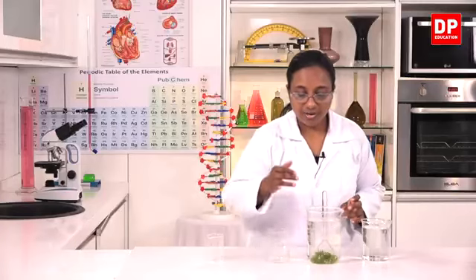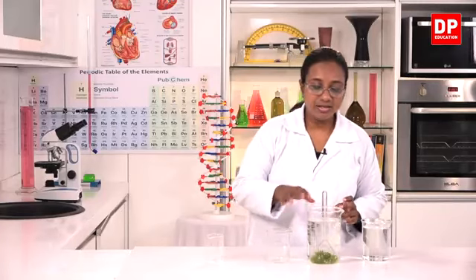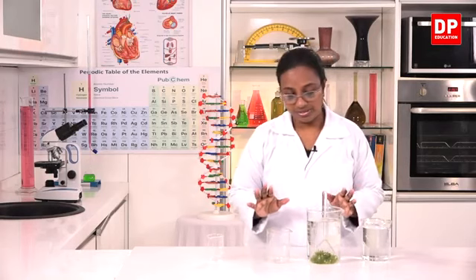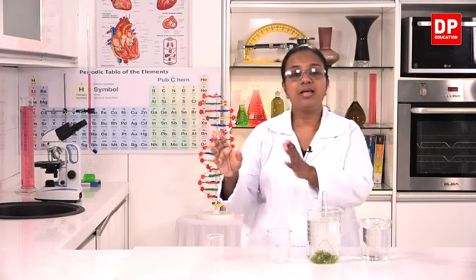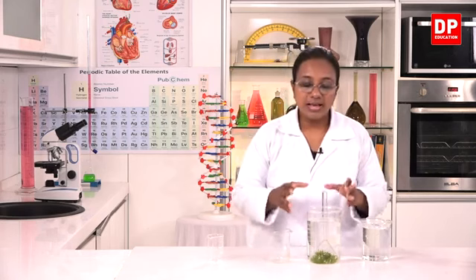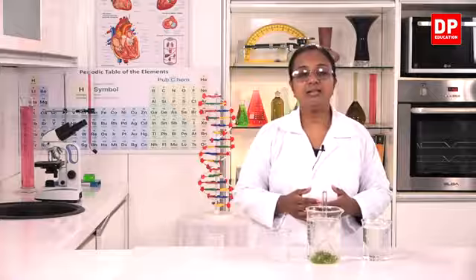The hydrilla plant is inside the funnel and the test tube contains water only. There are no gas bubbles inside. Now we will have to place this setup in a place where there is enough sunlight or direct sunlight. That is for about 2 to 3 hours. Then afterwards, when we observe, we can see the observations that need to be there.